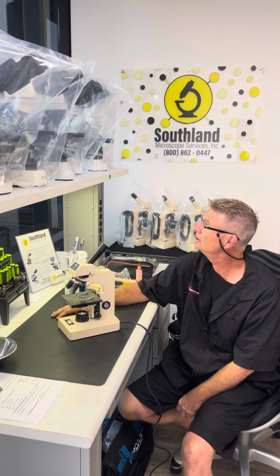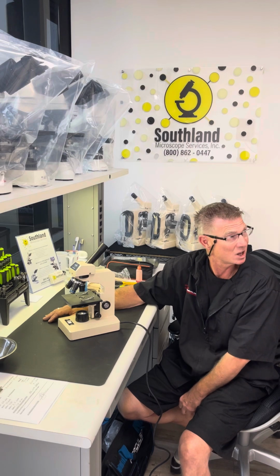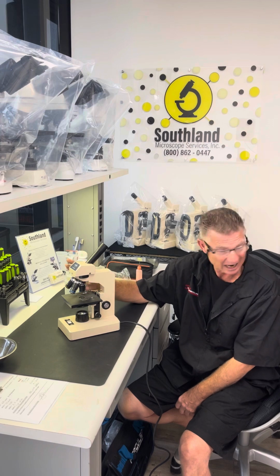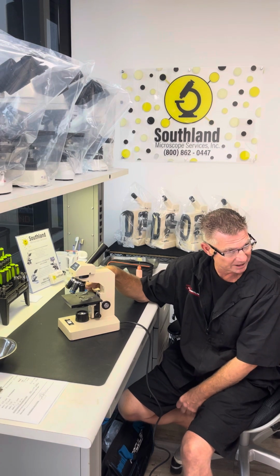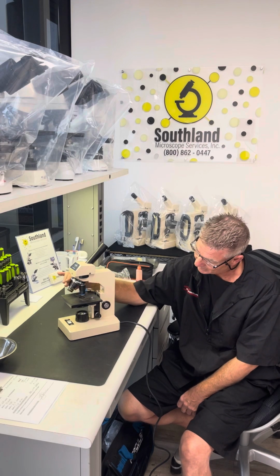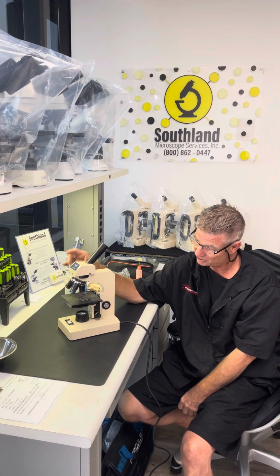It also has different uses, which would be a different type of microscope, in the electronics assembly area. Micro components in electronics are small, so there's a lot of soldering and a lot of assembly that takes place at a higher magnification. Those microscopes are 10 times 2, so they're 20 to 40 times magnification because you're dealing with something you can manipulate. This is going up to 400 times. They offer another microscope that goes up to 100 times, which is 1,000. That's usually what's going on.